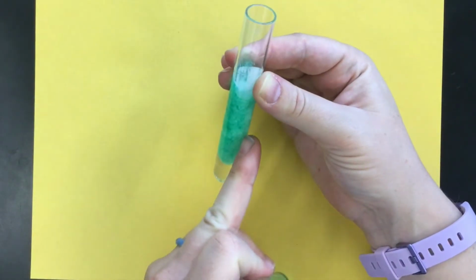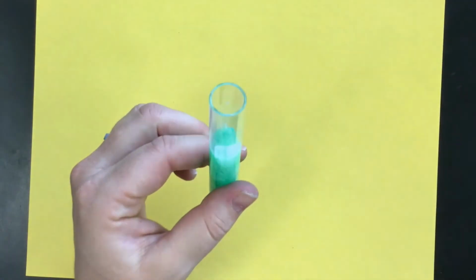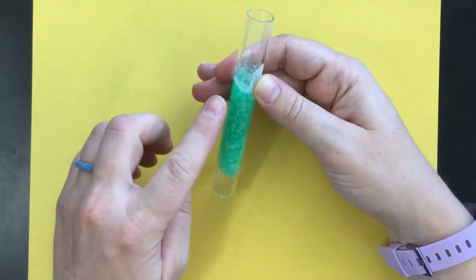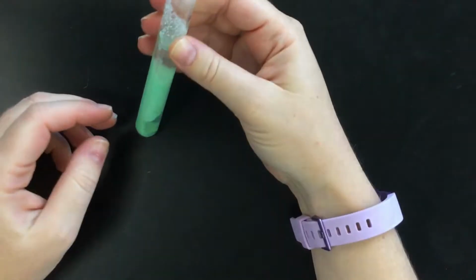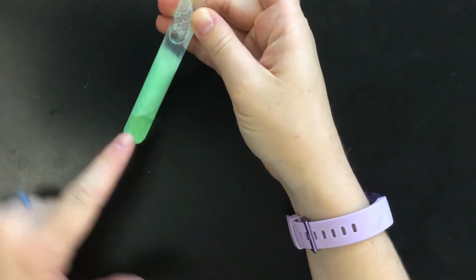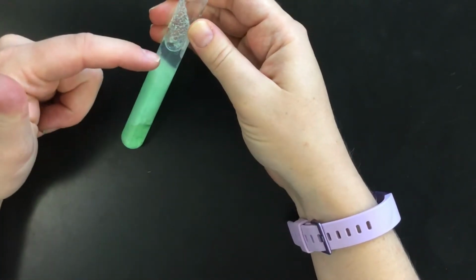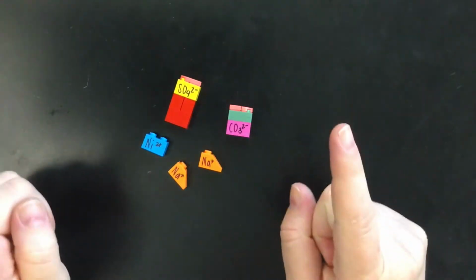And we see immediately it makes this very cloudy salt. I can mix this and centrifuge it, and then we can hypothesize about what this insoluble salt is. So I've spun my salt down here, and you can see I've got a liquid, and then this salt here. This salt cannot dissolve in the water. It's an insoluble salt. So let's look at what that means in terms of the Legos.